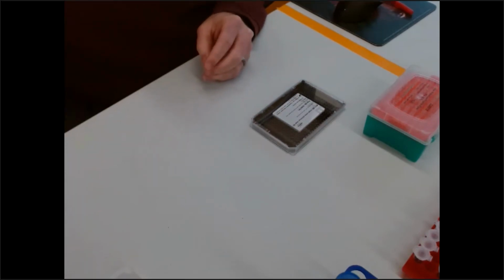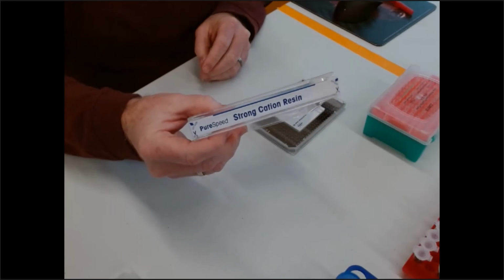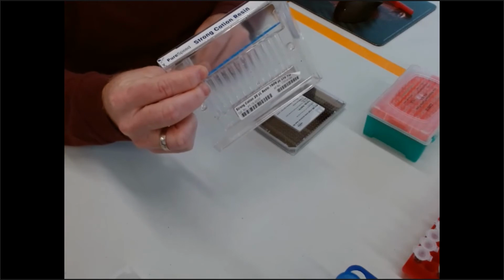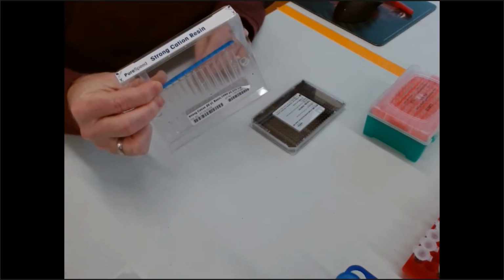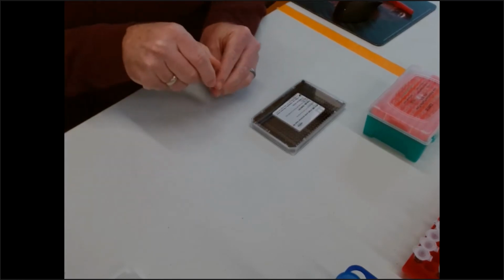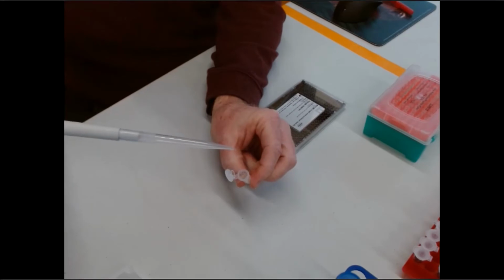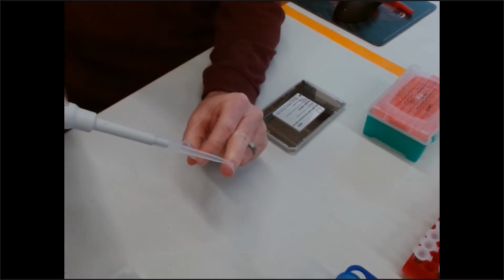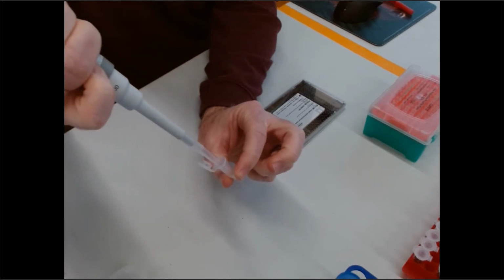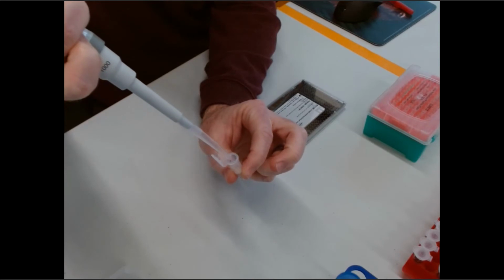And we're going to use a strong cation exchange resin embedded pipette tip to deionize and remove the naturally abundant sodium and potassium. And that's really just as simple as taking the sample with the pipette tip with the resin embedded at the tip and just pipetting back and forth in this vial 4, 5, or 6 times.